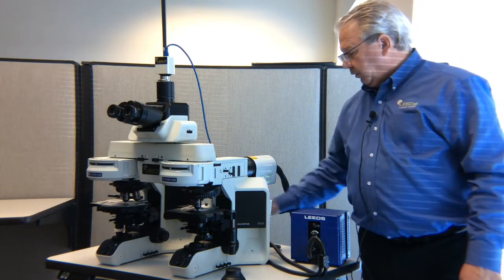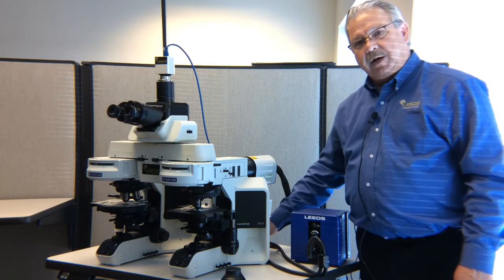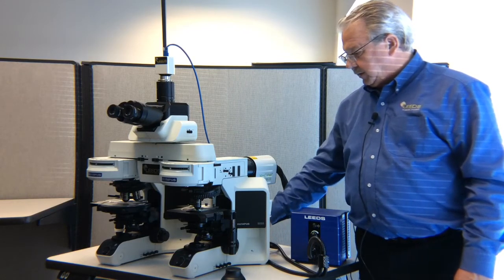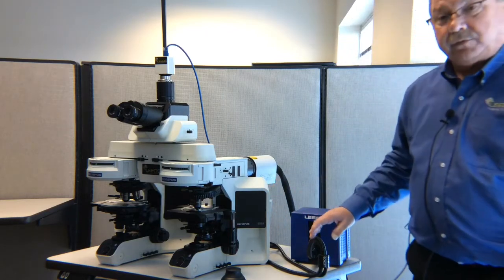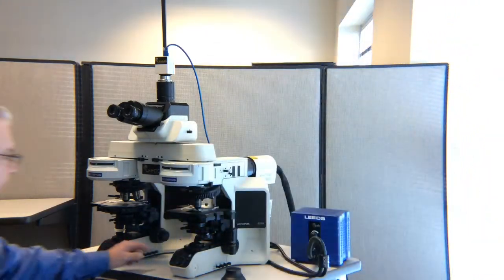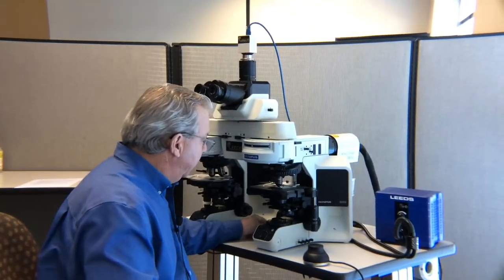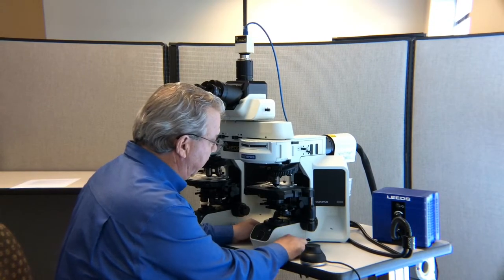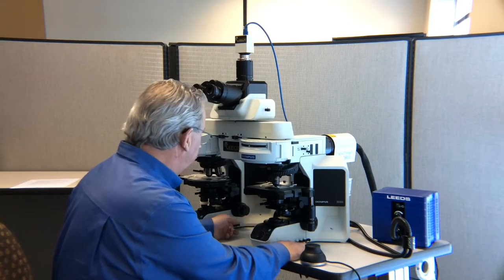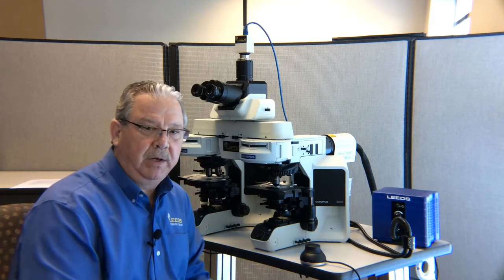So once we know we've got everything on the right and the left, we're going to insert our fiber optic cables all the way into the collector lens back here, and then start moving forward through the illumination ray path. Some of your microscopes will have optional in-base filters. If we do have those optional in-base filters, they're controlled by small levers down here, and we're going to want to have all those filters out of that ray path.